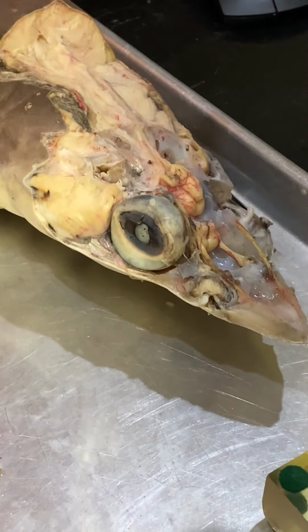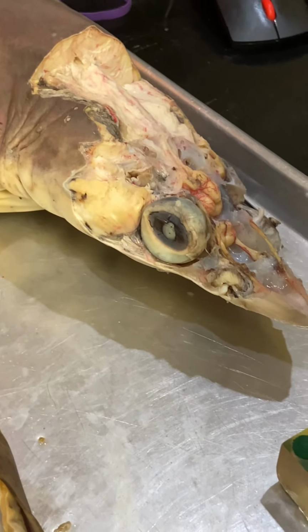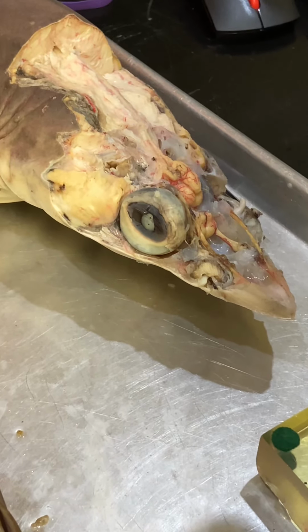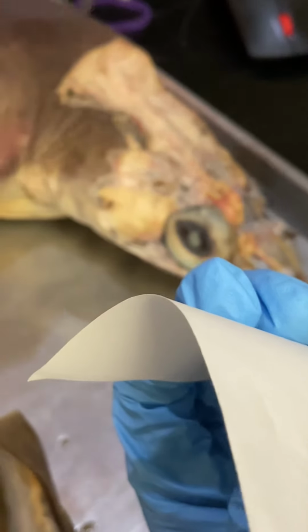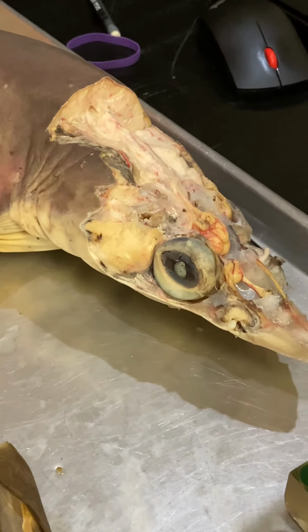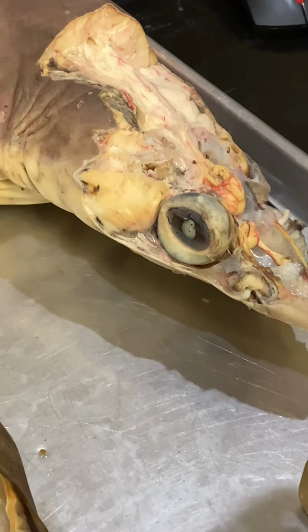And also I could have things pinned and ask you which region of the cranium or the brain it is. So the telencephalon, the diencephalon, mesencephalon, metencephalon, like that. The other thing that I could potentially do is have one of those structures pinned and ask you to name, say, a cranial nerve that originates from this region of the brain.